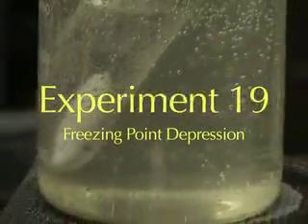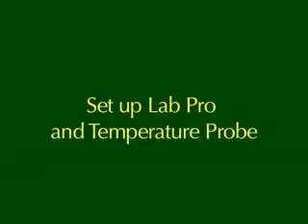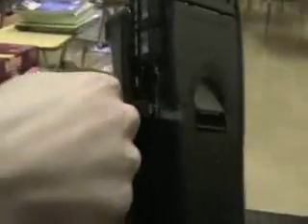The freezing point of a substance will depress, or go down, when another substance is dissolved in it, similar to the way the boiling point will increase when another substance is dissolved in a pure substance. In order to measure the freezing point, we need some temperature measuring device. Here we set up a LabPro with a temperature probe. We could also use a thermometer.